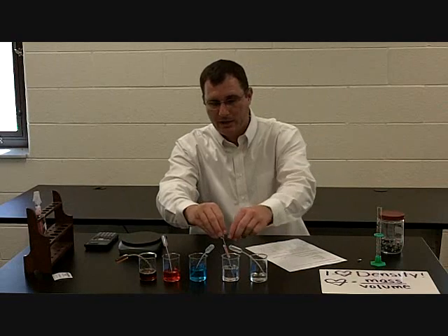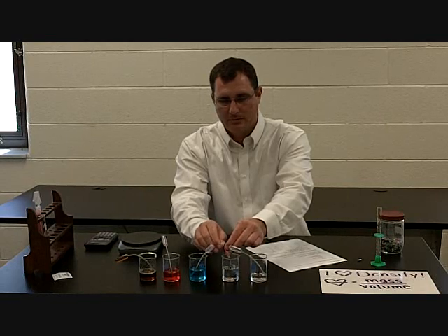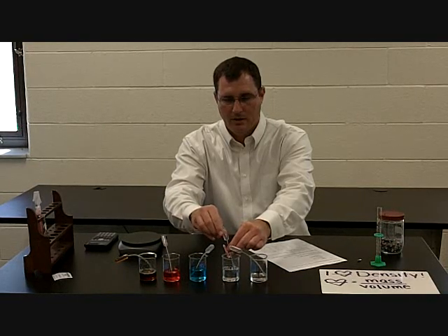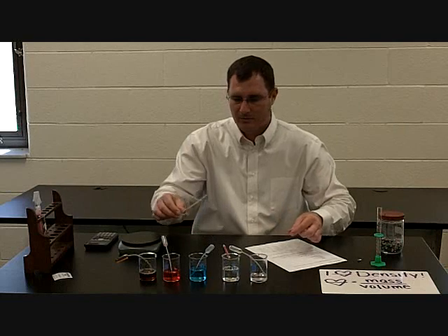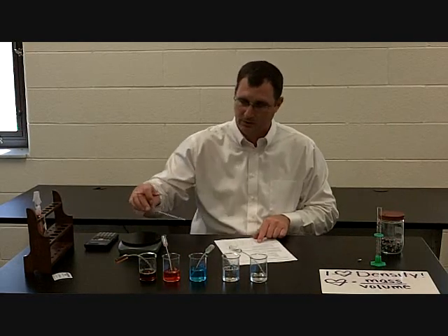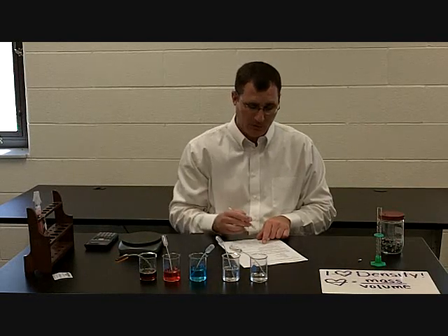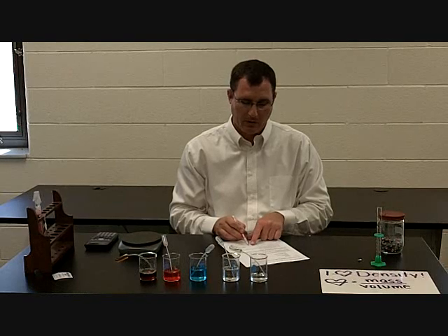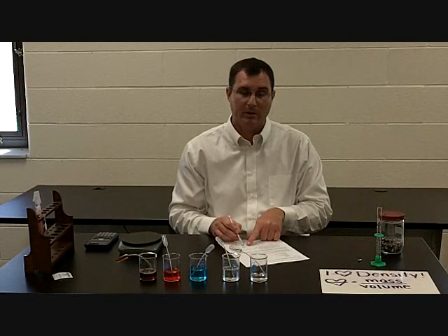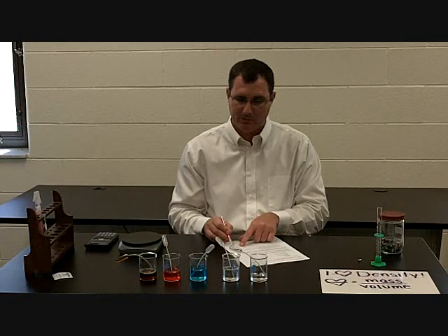Next I'm going to do the mineral oil. I get one squeeze and get most of it full, get the air out and let it pull up. Once it's totally full, I weigh it — mineral oil weighs 4.9 grams. Subtracting 0.9 grams for the pipette gives me 4.0 grams. Divided by 4.8 milliliters gives me 0.83 grams per milliliter.